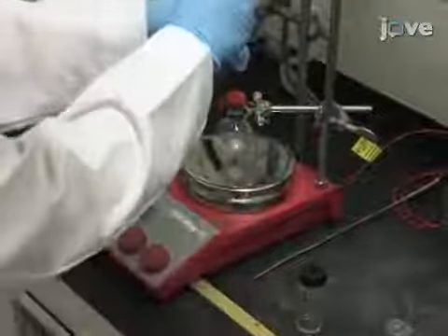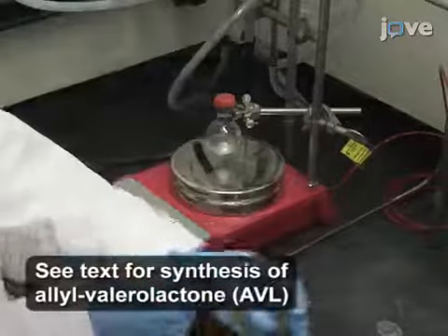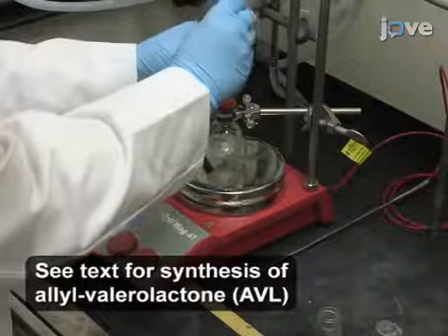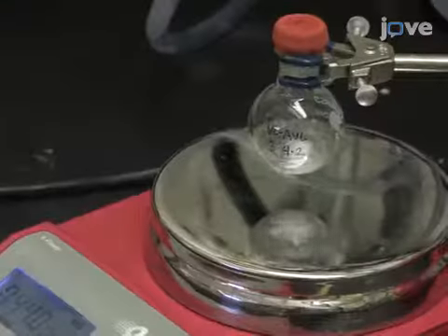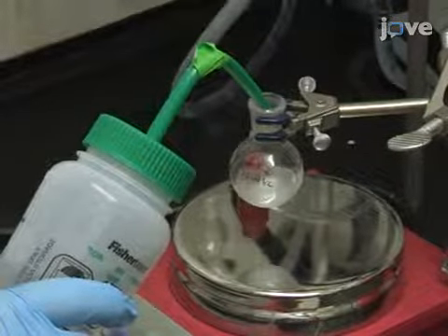Next, sequentially add 0.48 milliliters of AVL and 1.37 milliliters of VL. Allow the reaction to continue stirring for 18 to 20 hours. Quench the reaction by adding approximately 5 milliliters of methanol. Then, add 100 milligrams of solid support.